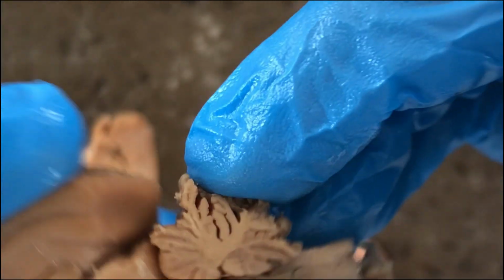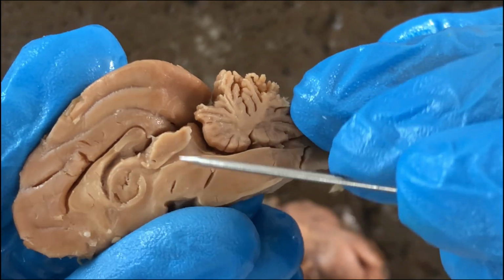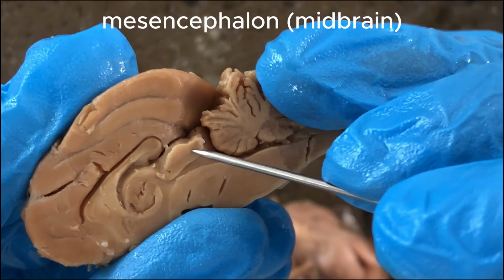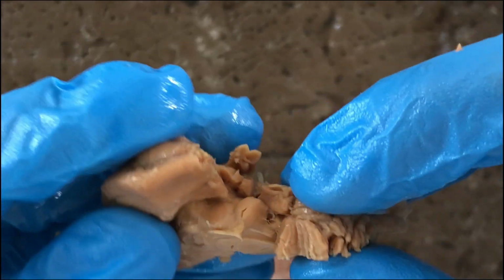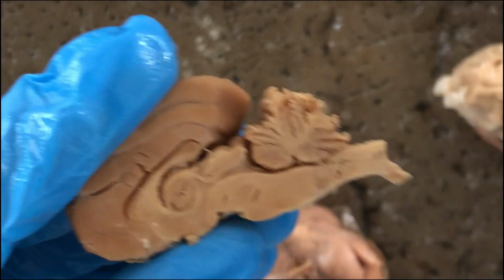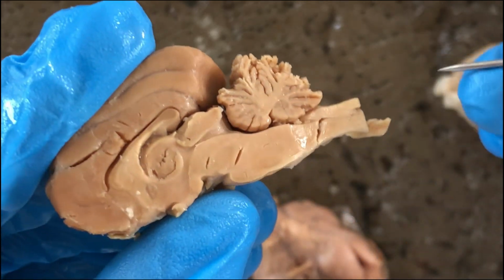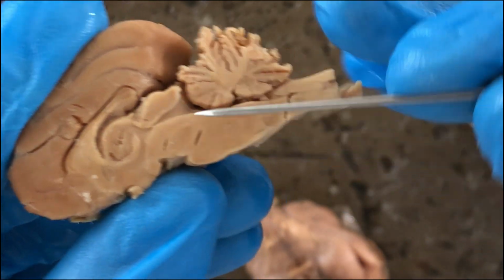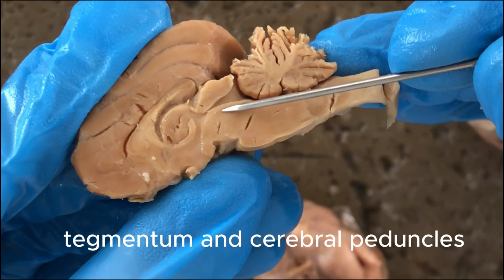And what else? So this region here would be the midbrain already. These are actually the corpora quadrigemina, right? The superior colliculus and the inferior colliculus. And this is the cerebral aqueduct. And the floor of the midbrain is called the tegmentum.